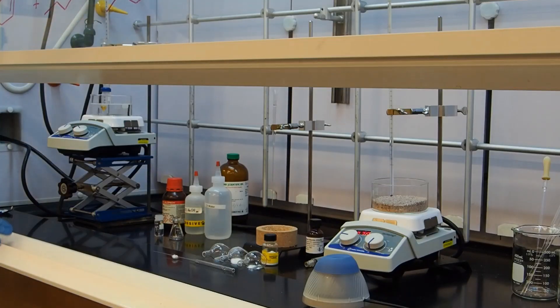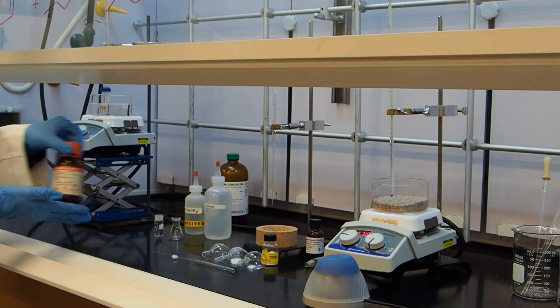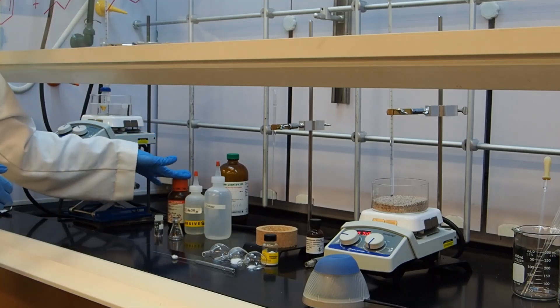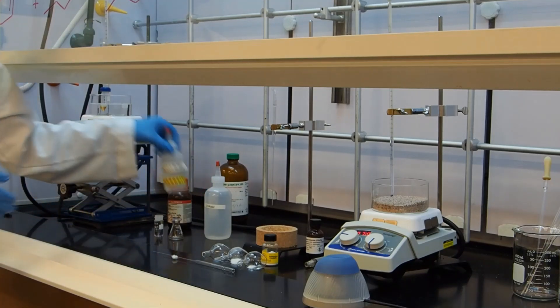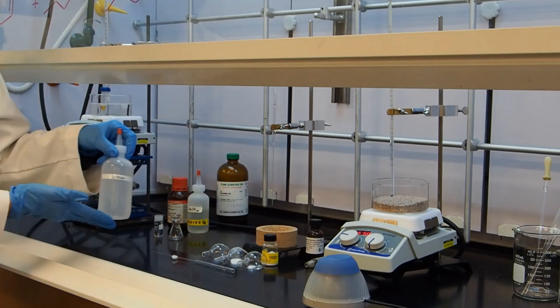The reaction is now boiling. While it's running, I've gathered a few things to get ready for the next steps. I have diethyl ether that is going to be used in the extraction part, also 25% sodium hydroxide along with some distilled water.